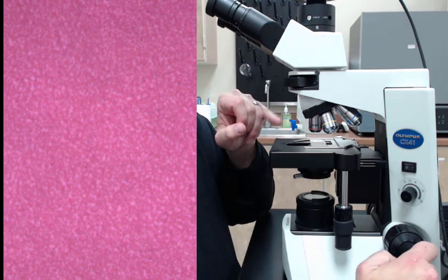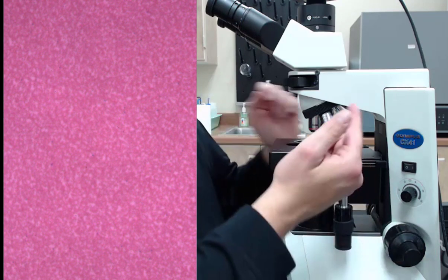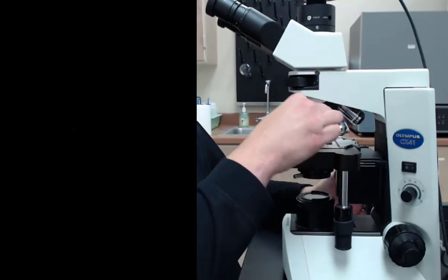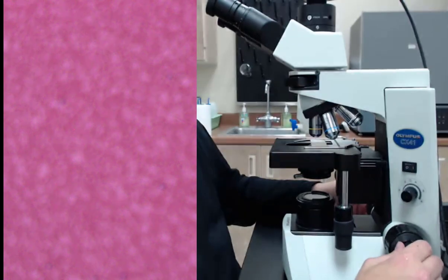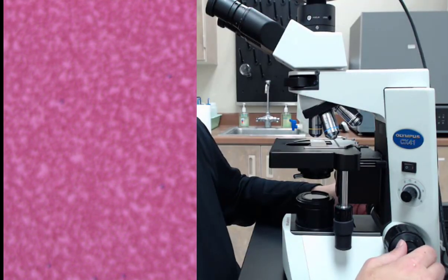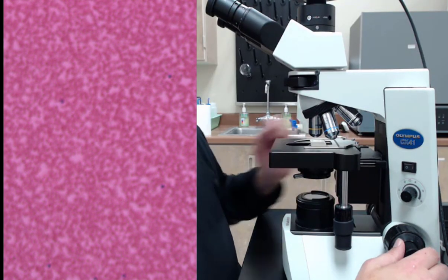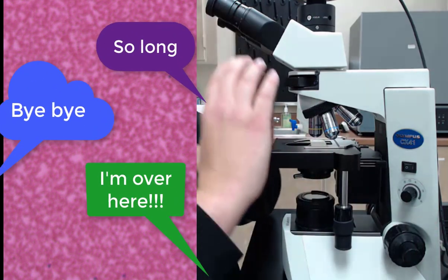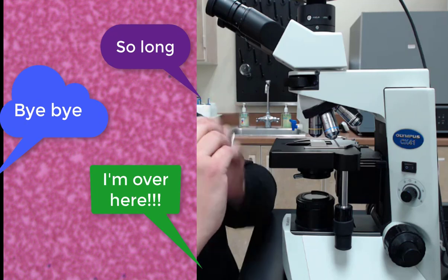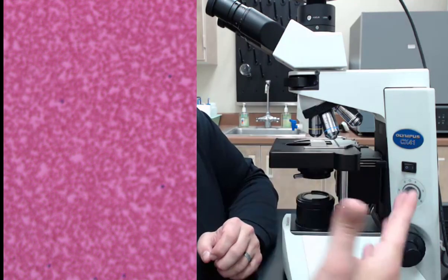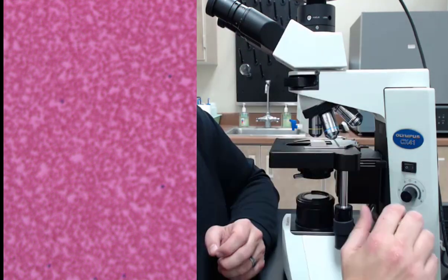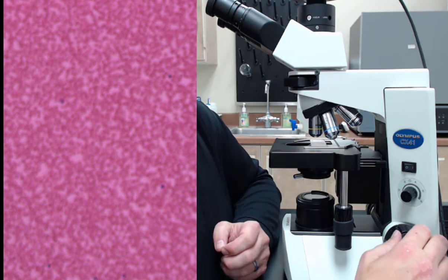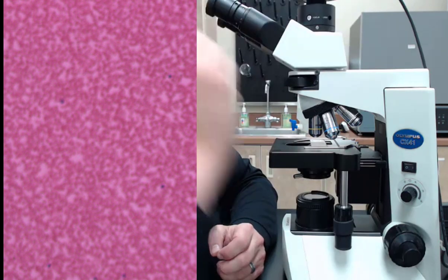And that's because right now we're looking through a 40x magnification. As I go to the next power, which I will now, the 10x magnification, a low power, the magnification has jumped from 40x to 100. So that means the magnification went up two and a half times, which means the field of view, which you can actually see, has gotten two and a half times smaller. So something looks really interesting on the right-hand side of the field of view inside the microscope. When I go to the next power, I'm not going to see it anymore. It's somewhere off to the side here.